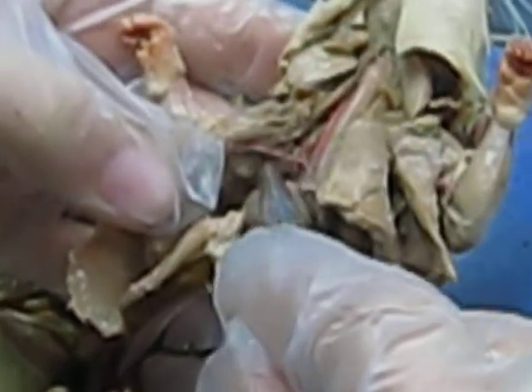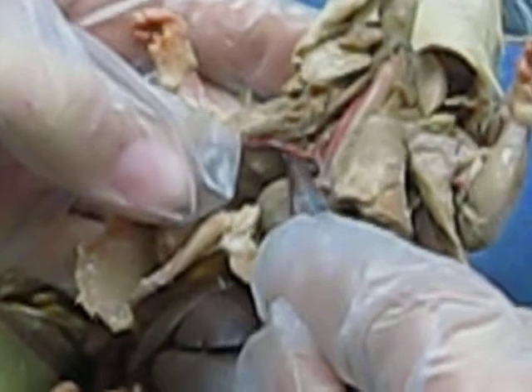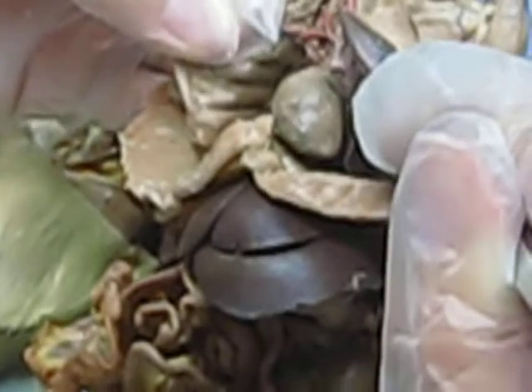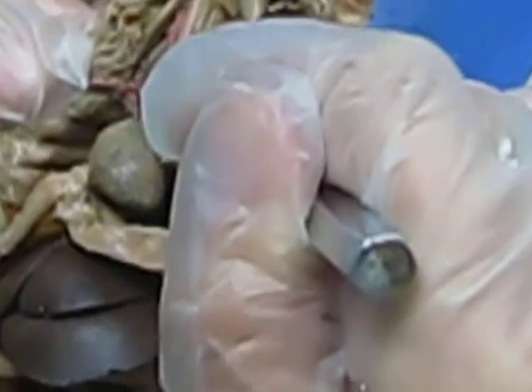Now, if you're looking for an artery that's your costocervical, it's going to be going back to your cervical vertebrae. So it's going to be the one that's branching down right there. See that little tiny thing? Can you guys all see that one? So that's your costocervical. The one that's coming back and going straight into the neck right here, going to your vertebrae, is your vertebral artery. Right there.